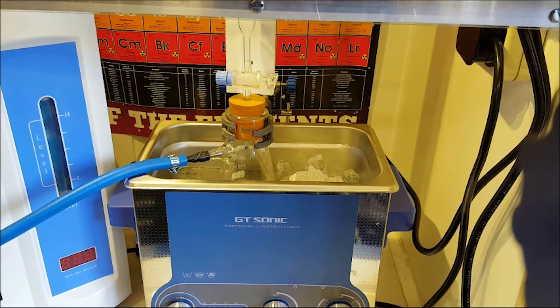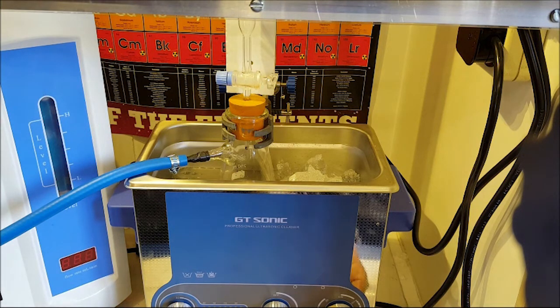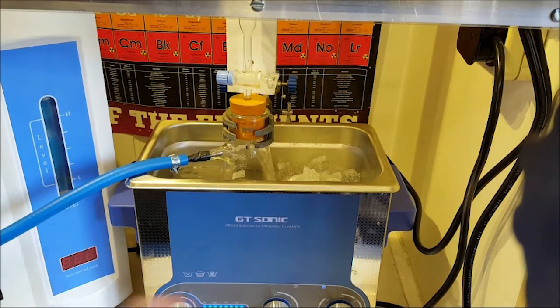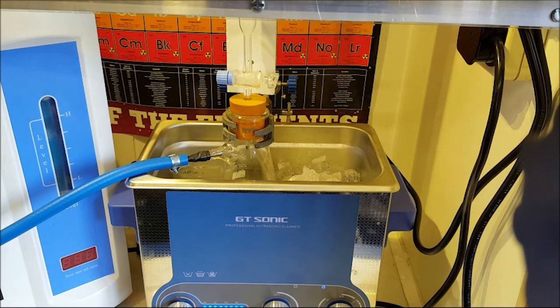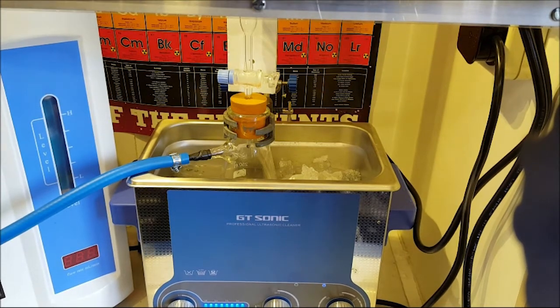Now you can see it's all set up to be sonicated. There's ice and water in the bath and the flask is right down on the bottom where it gets maximum impact from what is a relatively low power sonication system. But time is on our side. There's no hurry for this. I'm going to turn it on now and put the vacuum on.